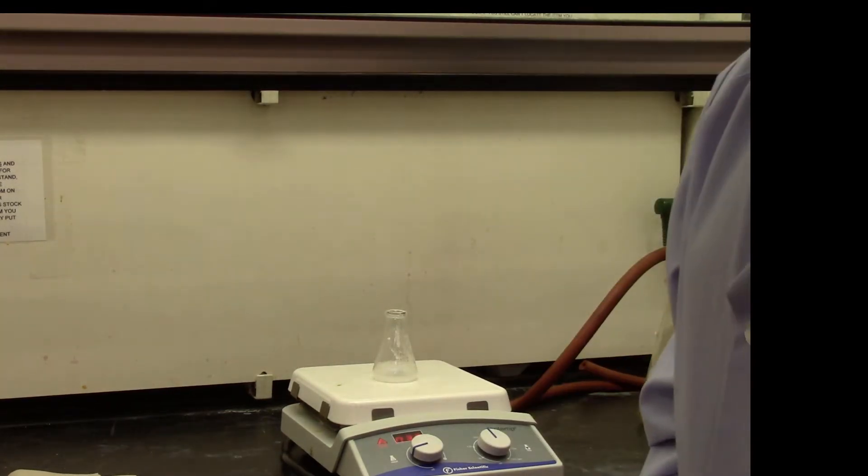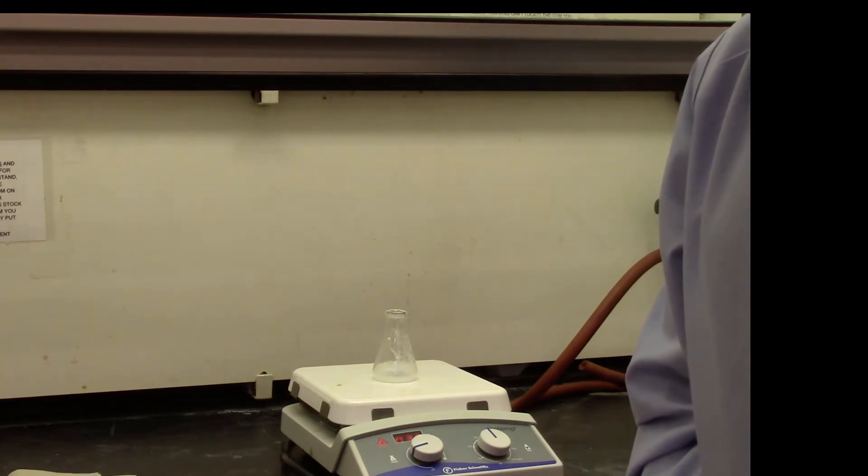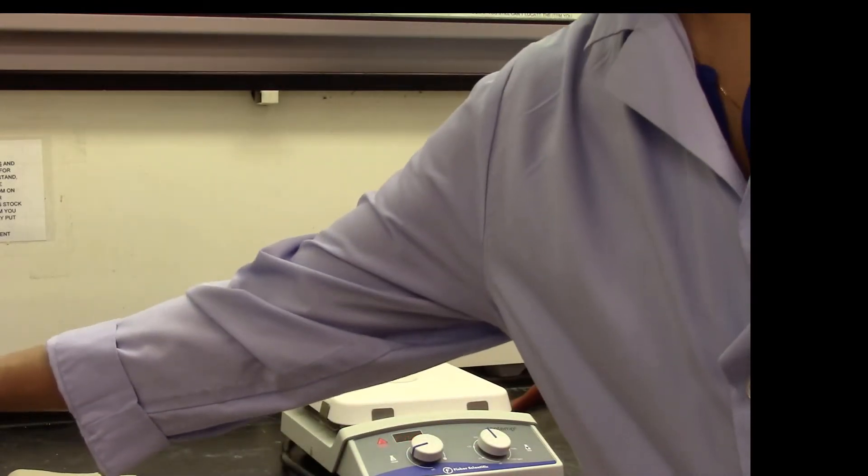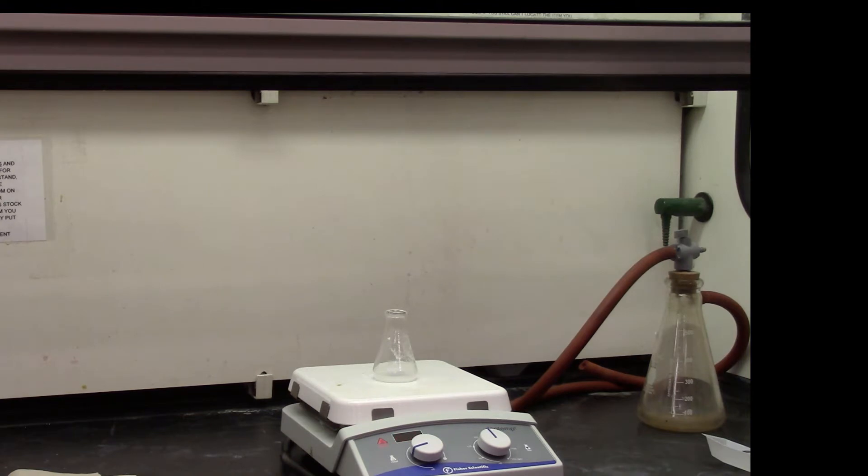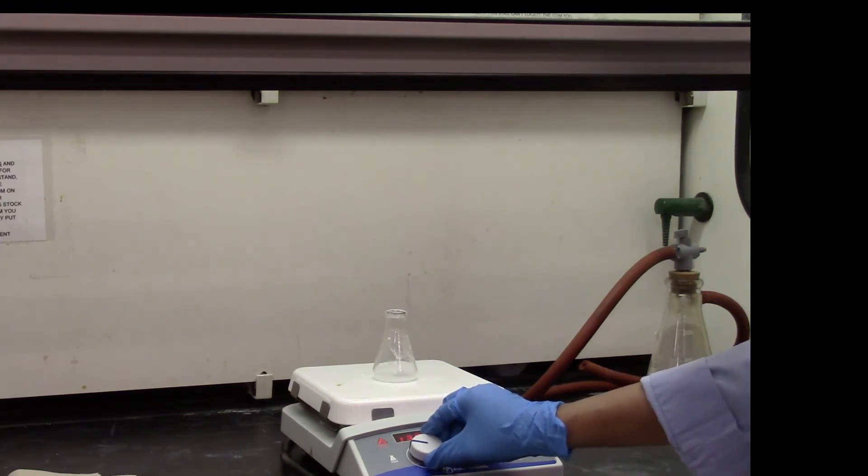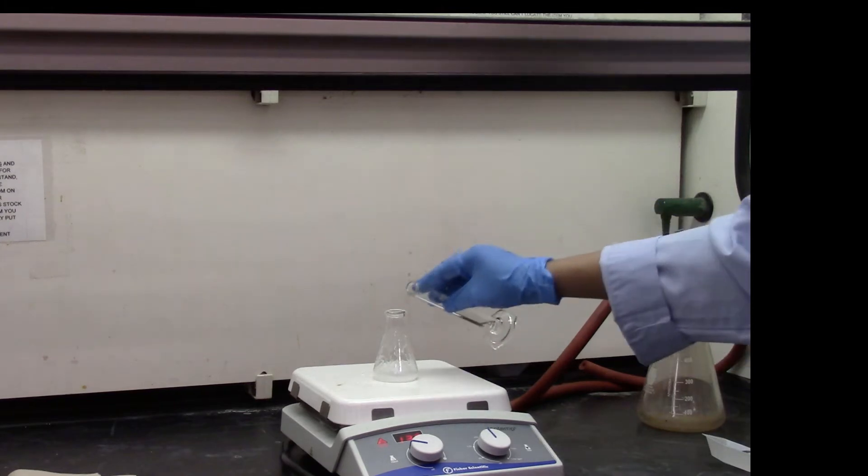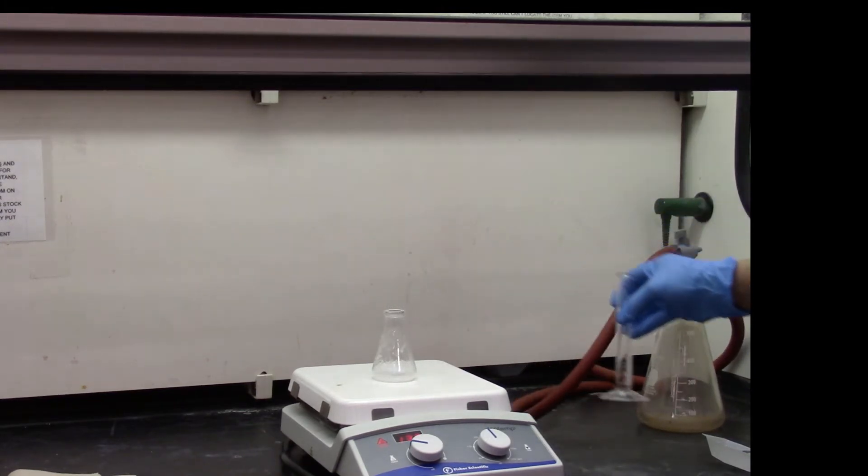I will let it boil for about 10 minutes and if it is drying completely I will add another 1 ml of methanol. So I'm going to add 1 ml of methanol just to make sure it doesn't dry completely.